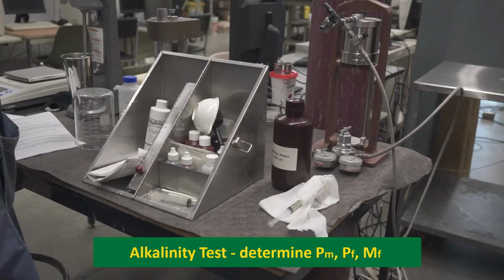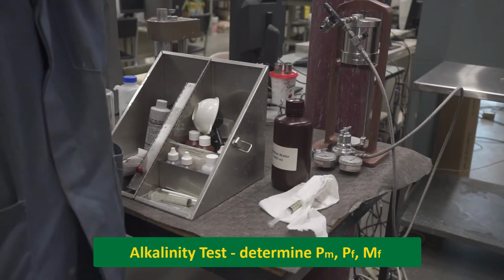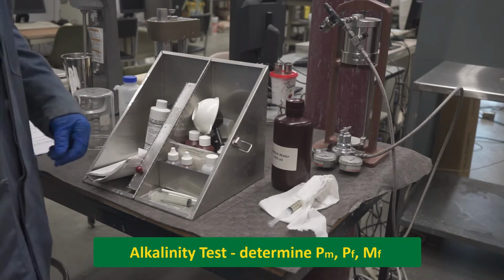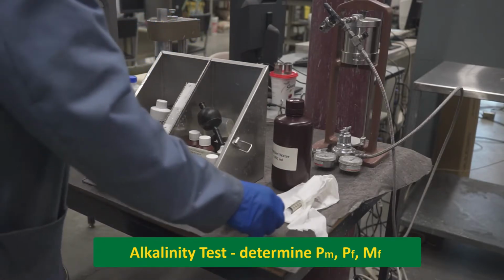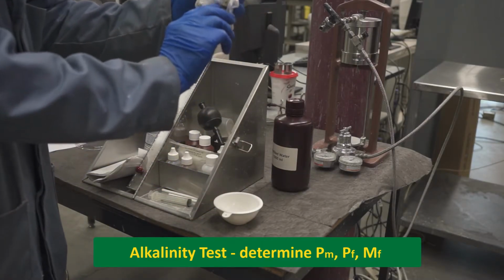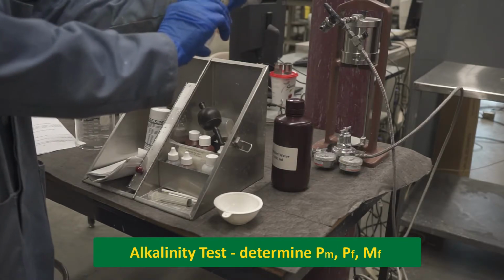The alkalinity tests must now be conducted in order to find the mud alkalinity PM, PF, and MF, the latter two of which were described in the last video. The mud alkalinity measures the alkalinity of the whole mud. When used alongside filtrate alkalinity determination, the excess lime present can be determined.